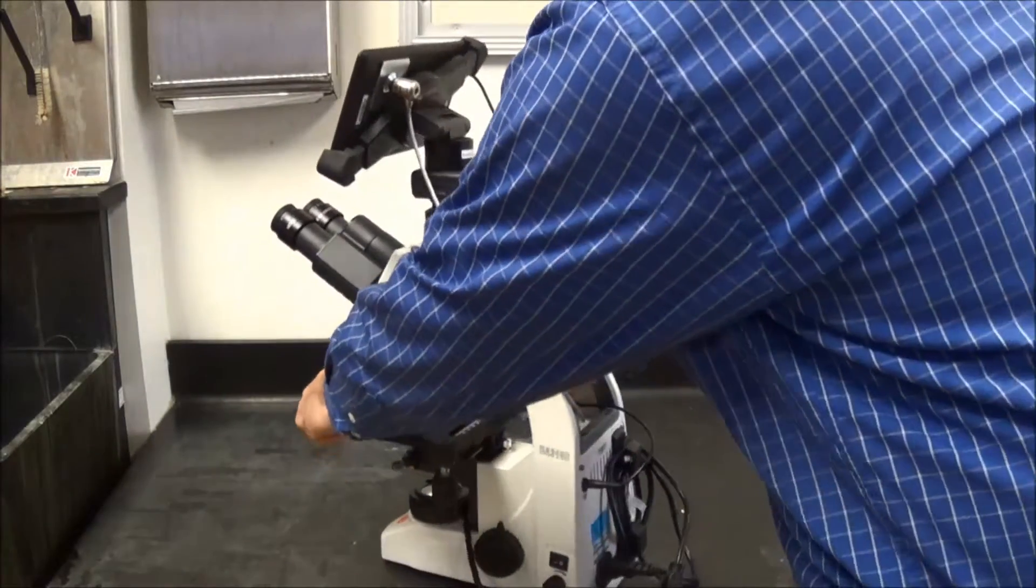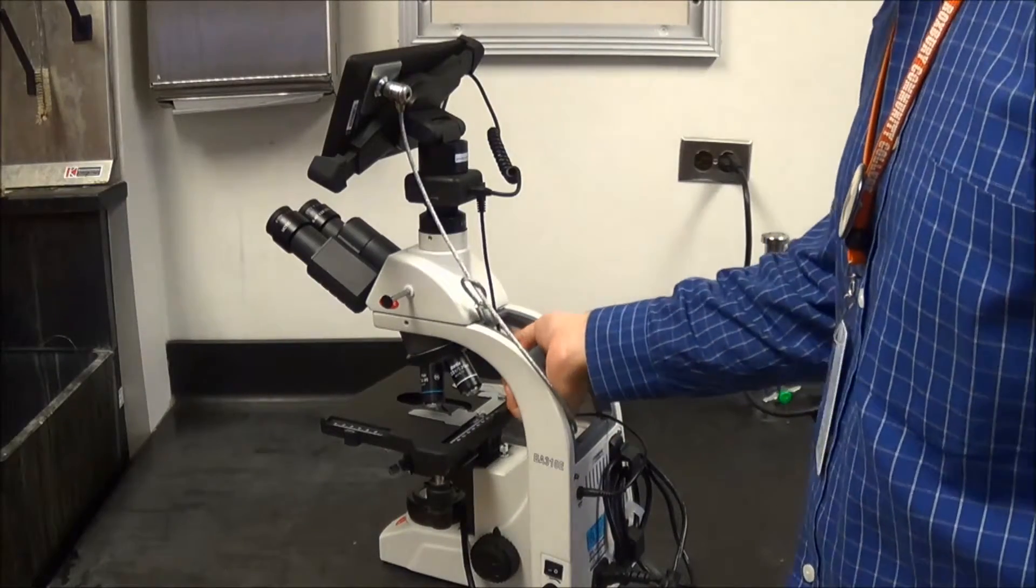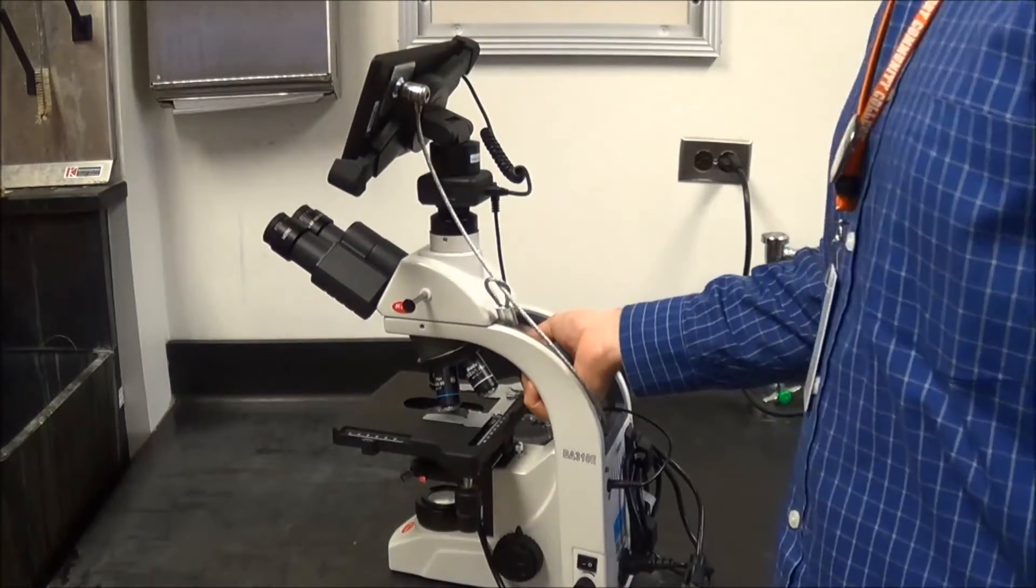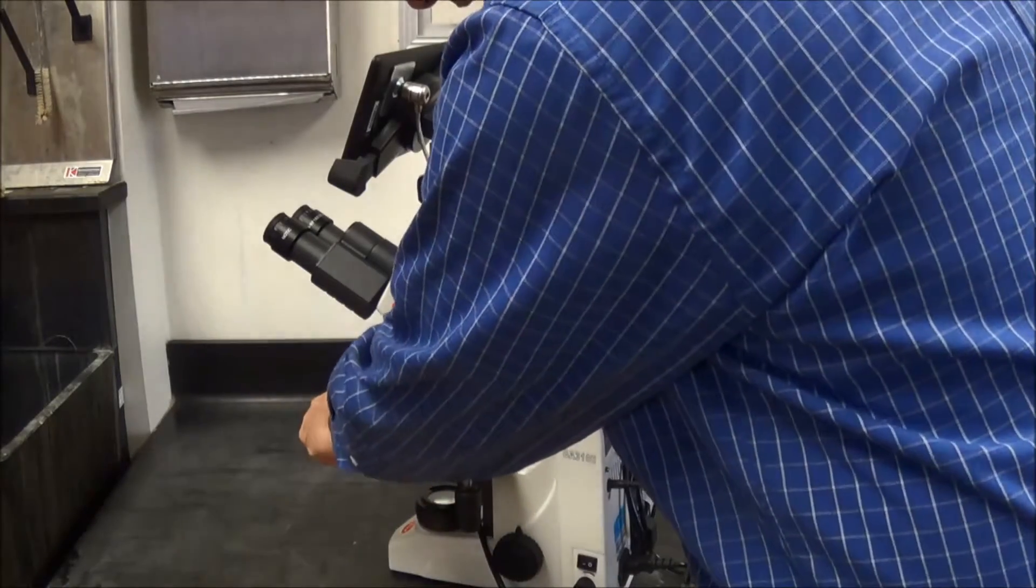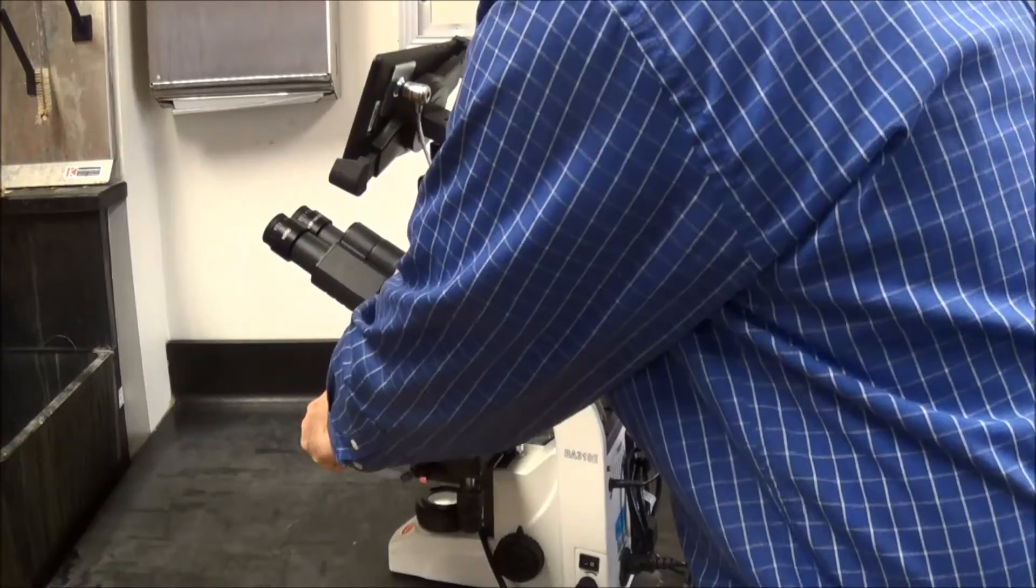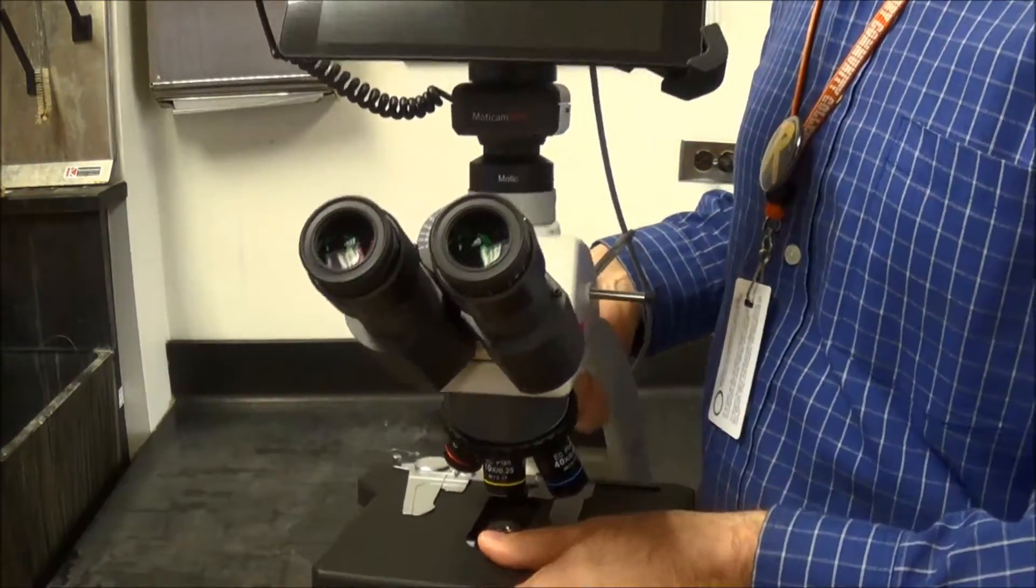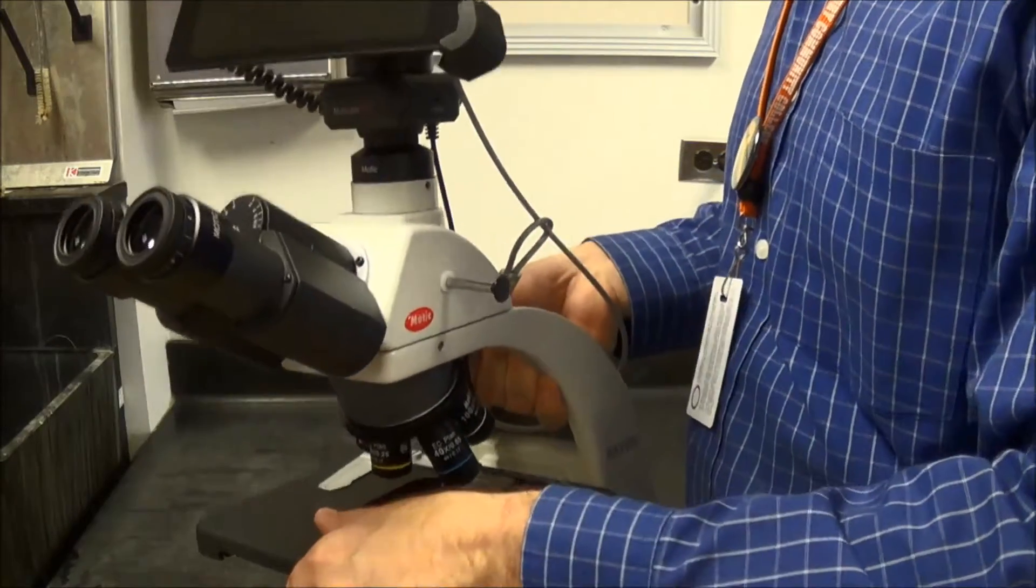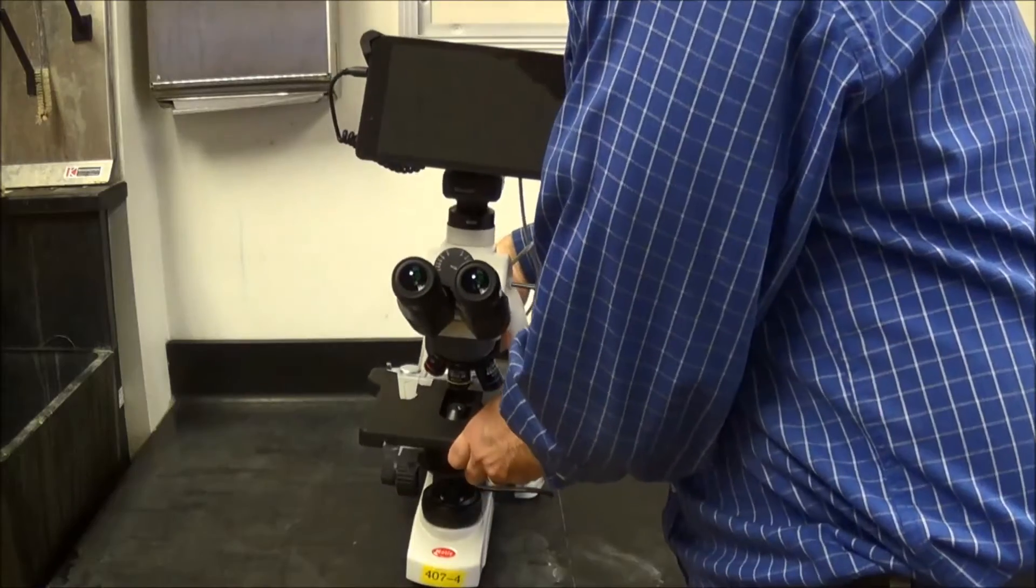I would recommend telling all your students to pick it up by this handle in the back. So this is one spot. And then remember, they should never be picking it up with just one hand. They should grab it over here by the platform. This is the best way to carry it. Two hands, one on the back, one on the front. And then they can carry it from their desk and put it back where it belongs.